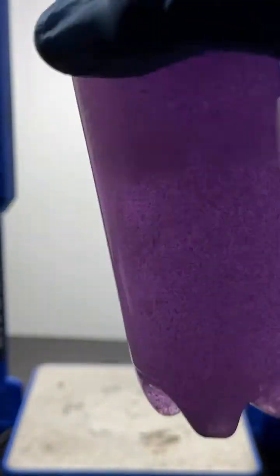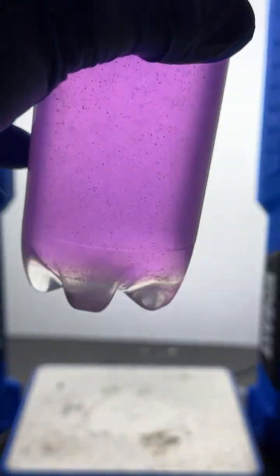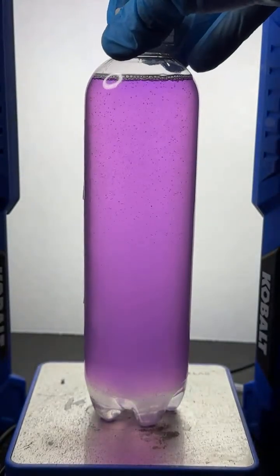Now remember, when I do this, the ions in the salt dissolve in the water, and there is going to be a very strong attraction between the water molecules and the ions from the salt. And that attraction is going to be so strong that it's going to push the alcohol out. I like to make the analogy like when 2 people fall in love and they love each other so much that they date exclusively, or they decide for the rest of their lives they're just going to be with each other. That's kind of like what's going on with the salt and the water right now. And there's just not room for anybody else. And so that means that the alcohol is going to get pushed out.